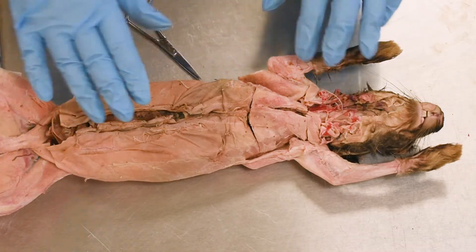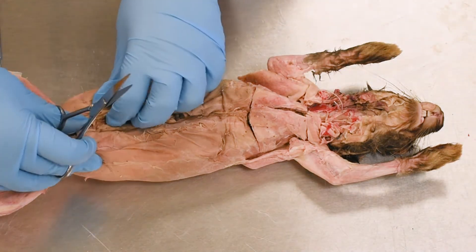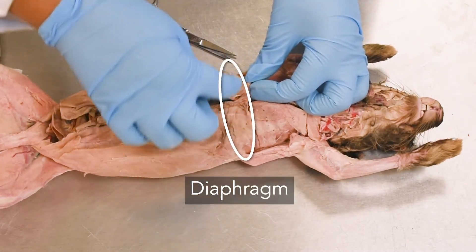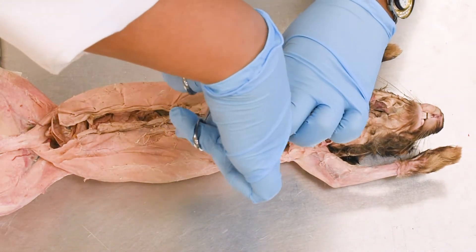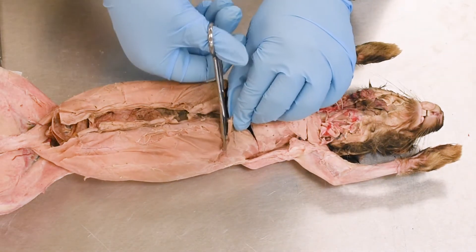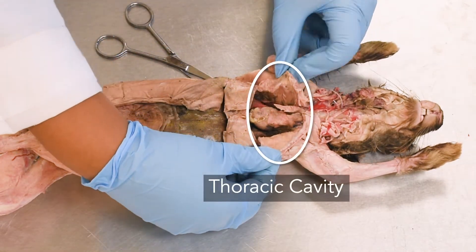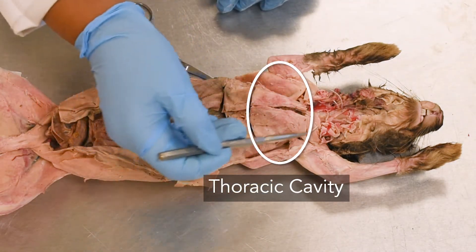First we will open up the body cavity. There are certain areas we will make the incision. As you can see, I opened up the abdominal cavity. When we start, we try to work around the diaphragm, so we will keep the diaphragm intact and then make incisions gently. This area is below the diaphragm, and this is superior to the diaphragm — that means this is the thoracic cavity where the heart is located.